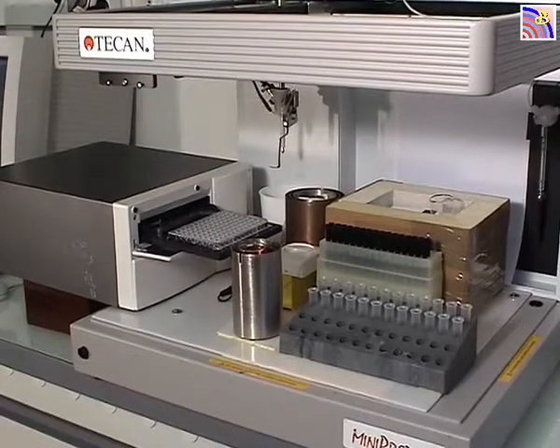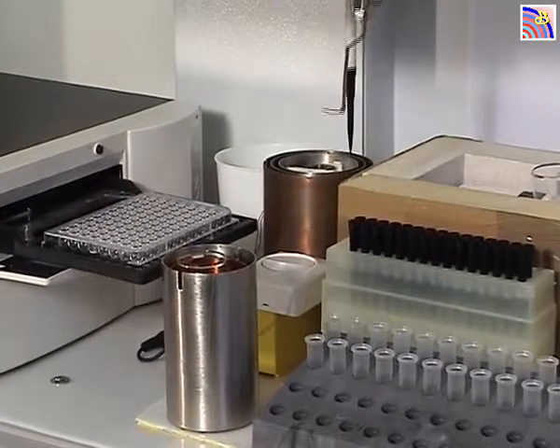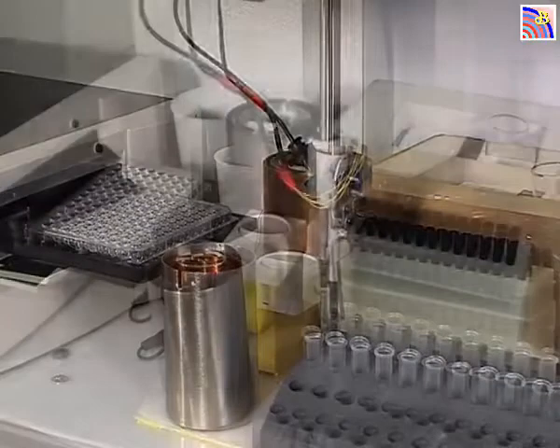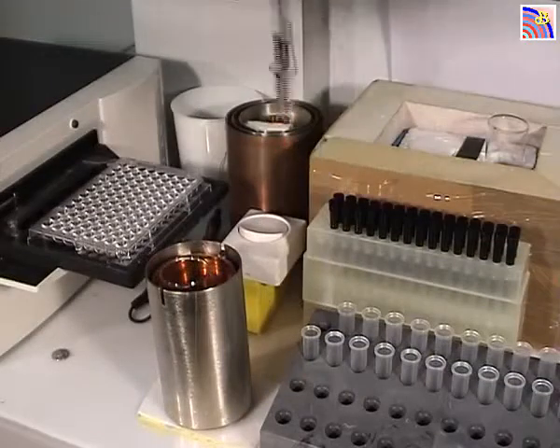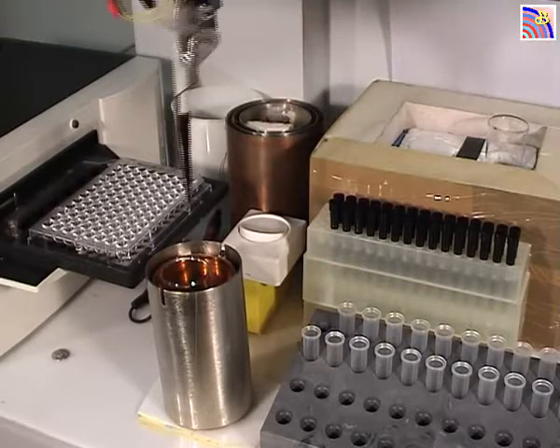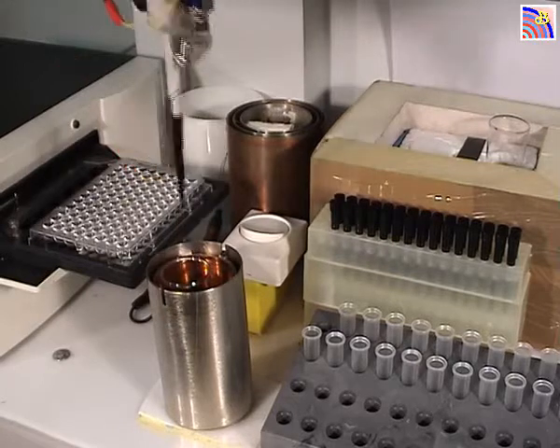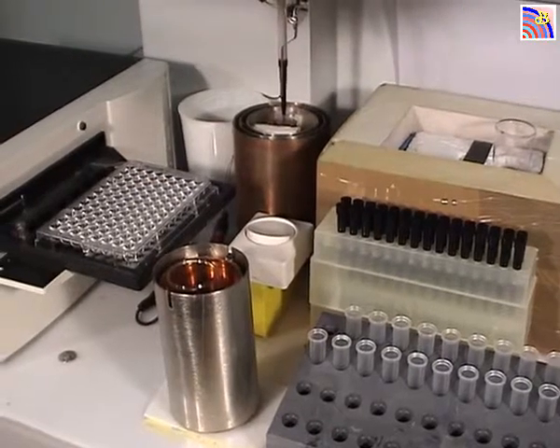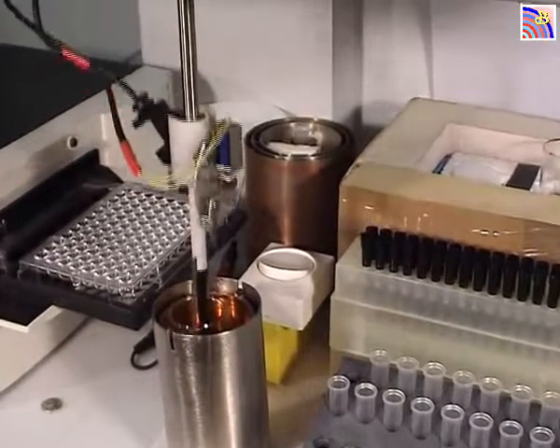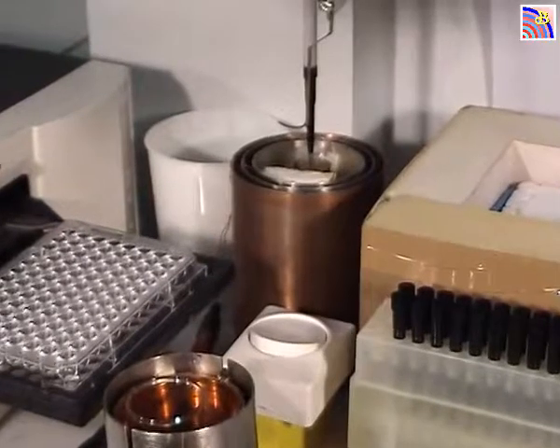Now the machine is working. It's picking up a tip, then it will take a tube — an empty tube — and put it into the carrier. Then it will get water and add it to this tube, and then a second aliquot of water is added to the tube.